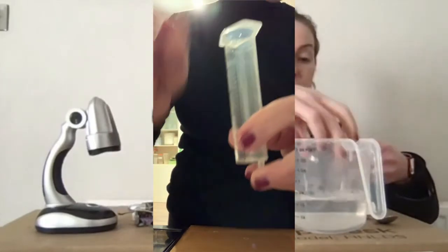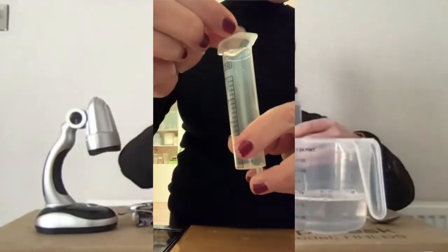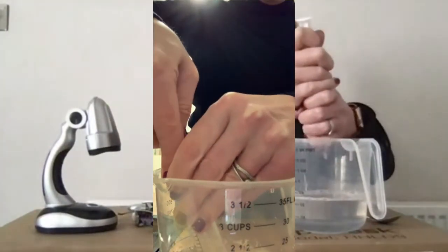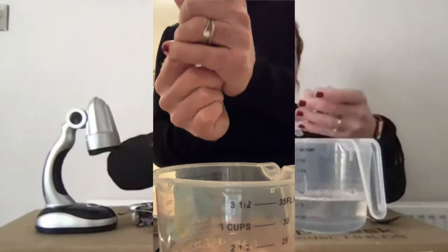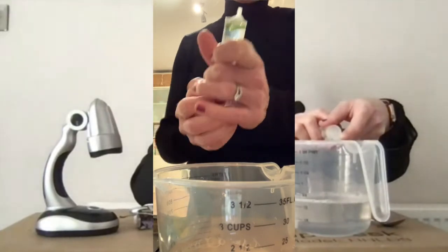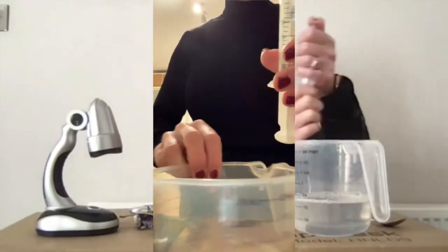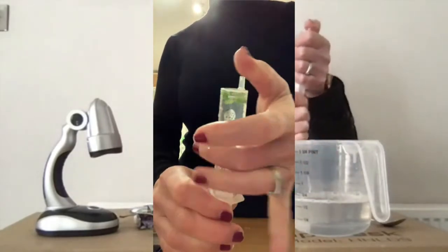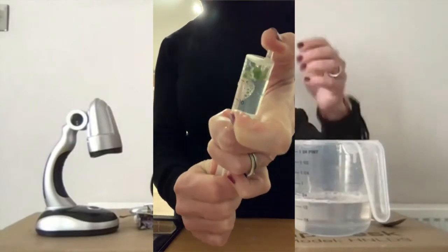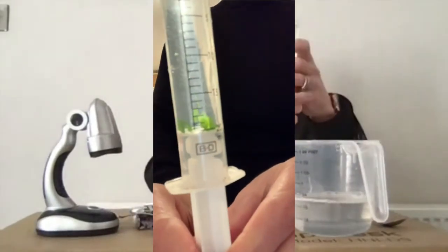Try to get a little bit more out. There we go. So now I've got the plunger, which goes into the syringe. And then I can expel some of the water, and I can get them, and then what I do to get them down to the bottom, I have to suck, by pulling the plunger, I suck the oxygen out, and hopefully that brings the leaf discs down to the bottom of the syringe.